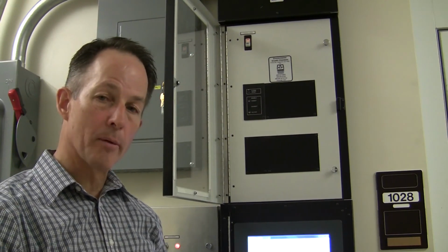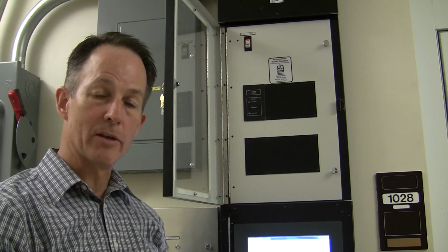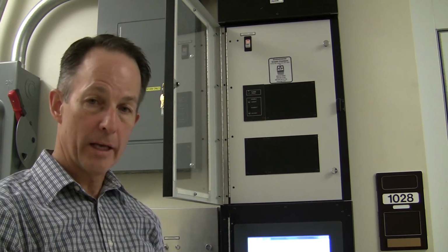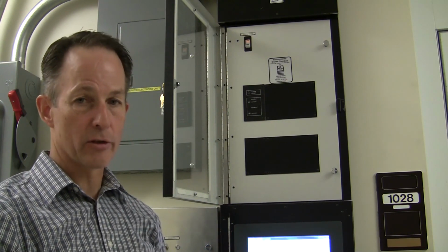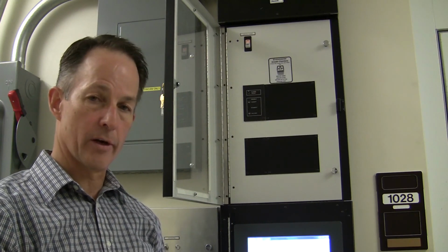If there are any problems with the operation of the box or the programming is not working as you need it to, please contact the Associate Dean over research or the air conditioning shop for their assistance.